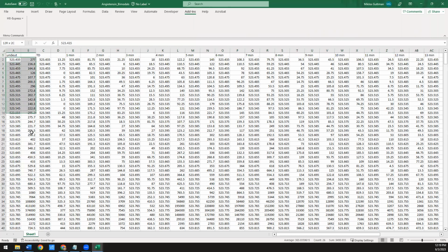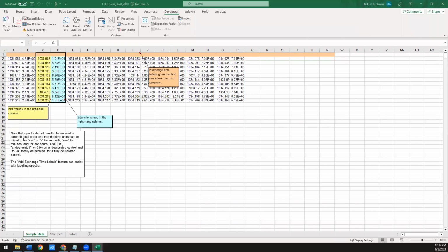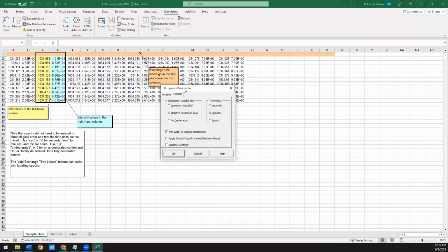So now you have all the XY data from all your spectra you want to process and the labels ready to go. At this point, we can do the first step where we go to HXExpress, analyze spectra. Here it pops up this HXExpress parameters window. And here you can specify how you want it to summarize the data once it fits it all. Would you like absolute mass, relative mass, percent deuteration? I always just use relative.